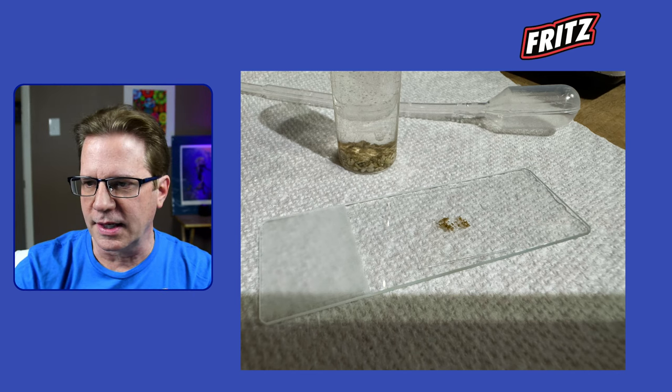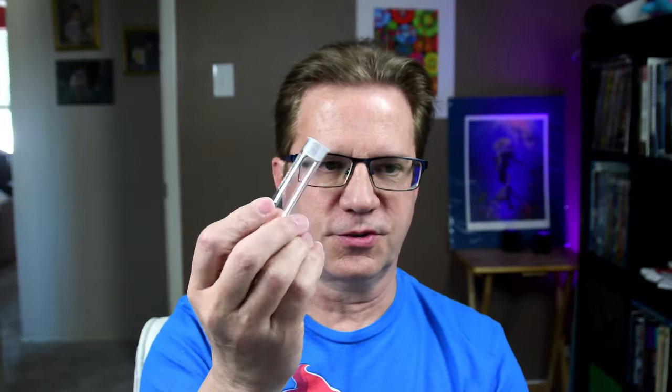Here's an example of the slide. The way I got my sample onto the slide was: I grabbed an Elos test kit tube, reached down into the tank, and scooped out a little tiny bit of sand — maybe 50 grains — with some water. I put the lid on top and shook it, which got whatever was on those grains of sand into suspension, making the water just a little bit cloudy.